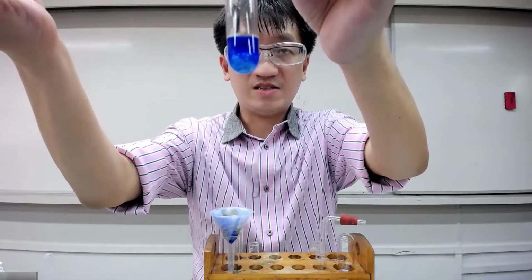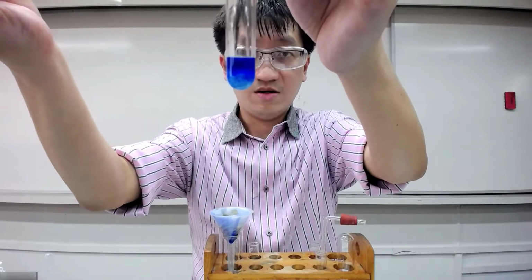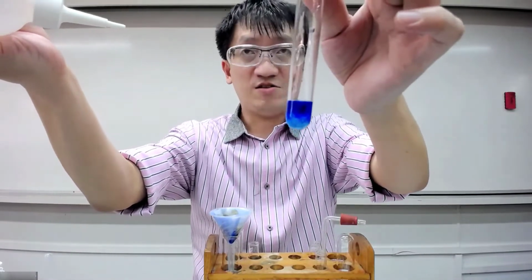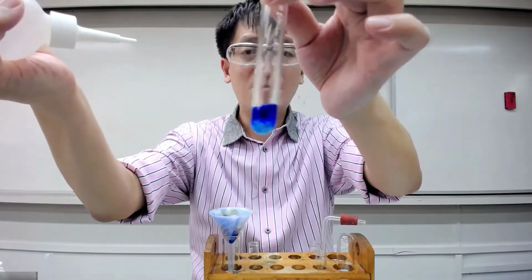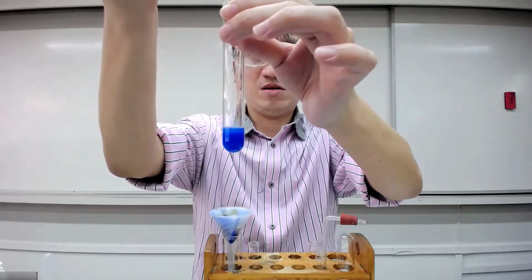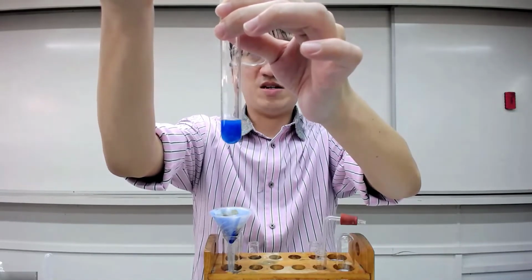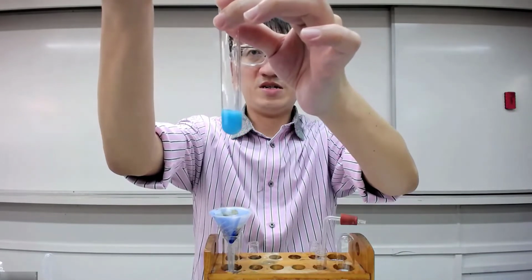Yeah, because usually the solution will sink to the bottom. So just for you to take note of it. Of course, if I swirl, the solution will be like a pale blue PPT swimming around dark blue filtrate, something like that. So I'm going to add in slowly, drop by drop. You can see the pale blue PPT starts to appear, so your hands have to be a little bit steady. Can you see the pale blue PPT forming already?